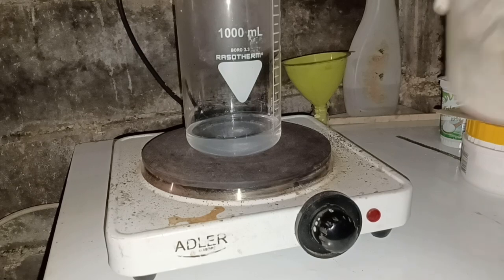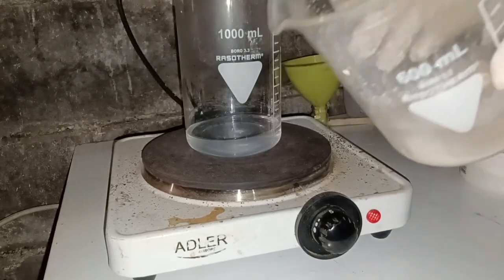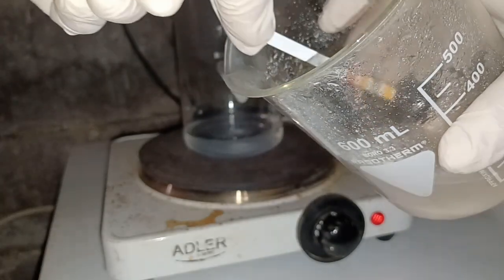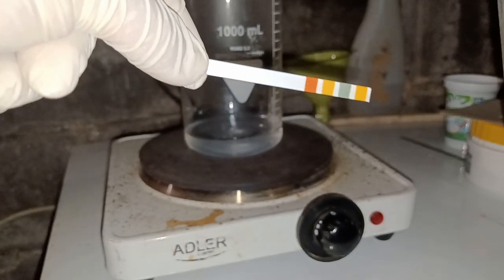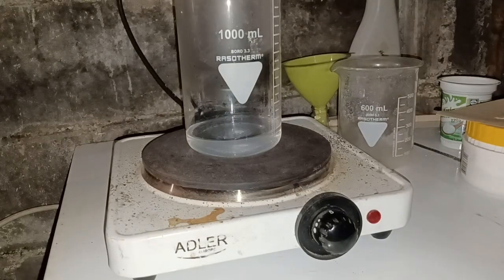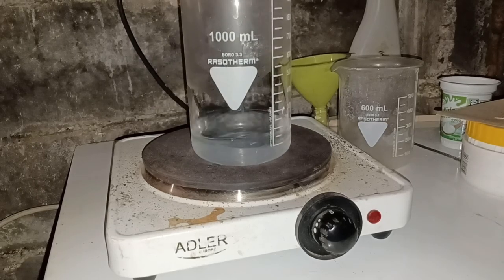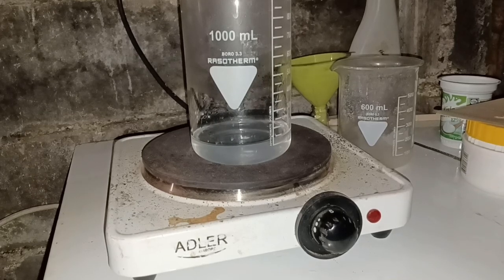Once I prepared the solutions, I measured their pH. Solution of calcium nitrate had a pH of 8, meaning it was slightly basic. There was some leftover calcium hydroxide. Slight excess of calcium ions is good. It helps to ensure there is no leftover oxalic acid in the end product.